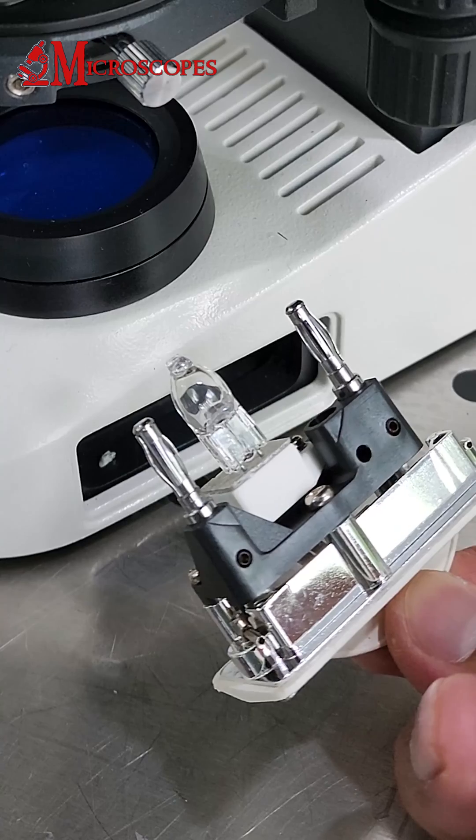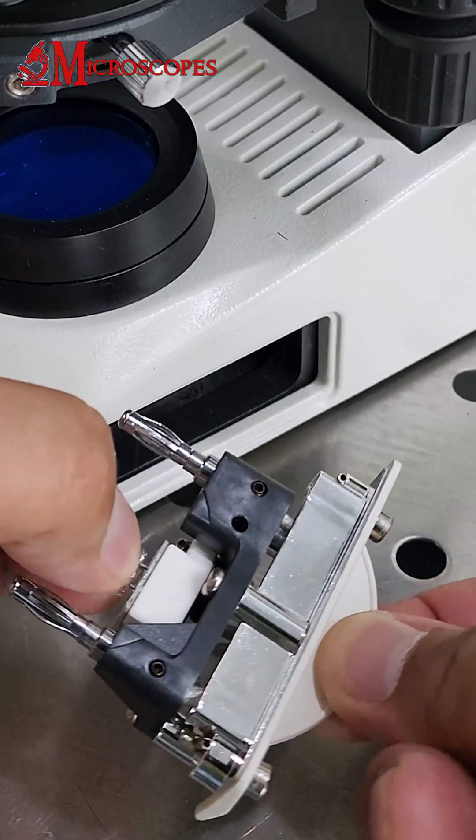You will see a broken bulb. Pull it out and replace it with a new halogen bulb.